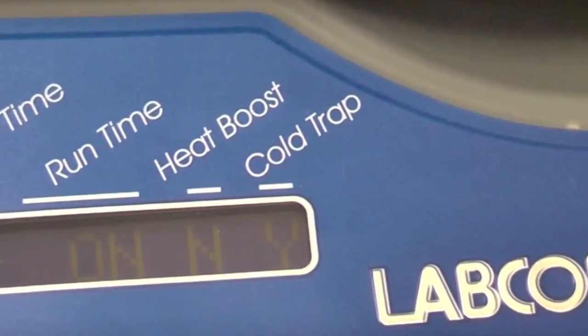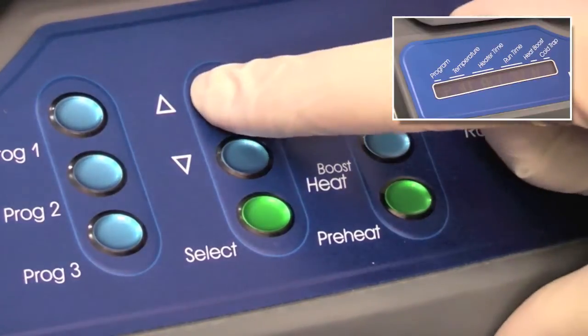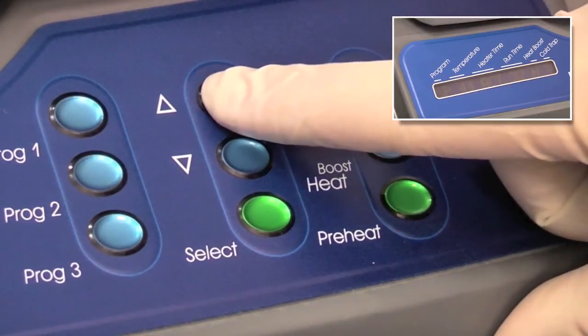Preheating the chamber prior to evaporation is recommended. Select Preheat and set it to the desired set point.